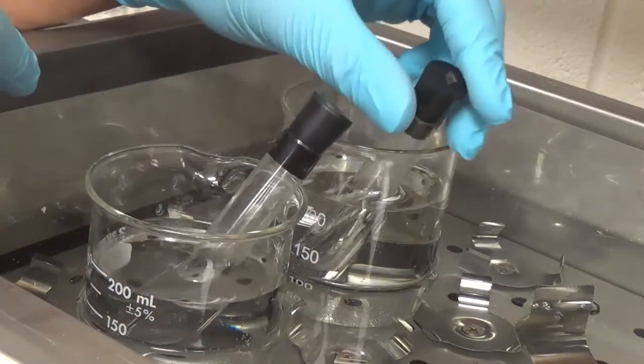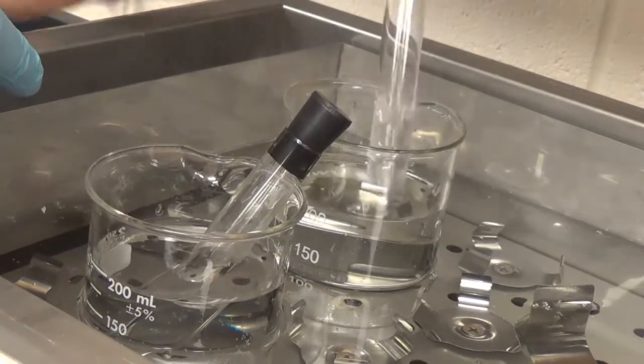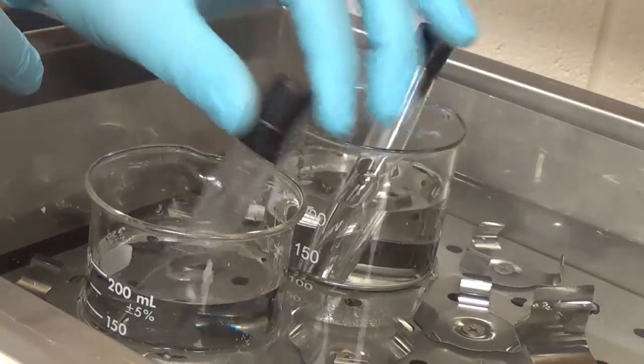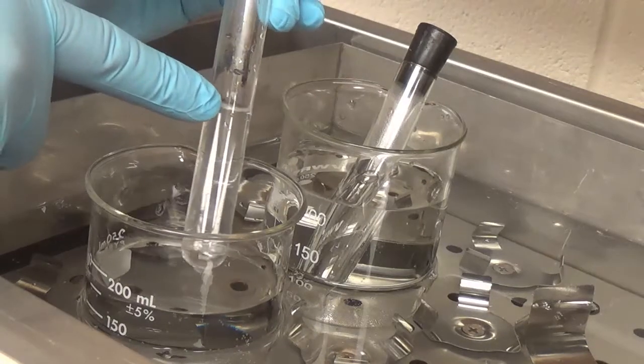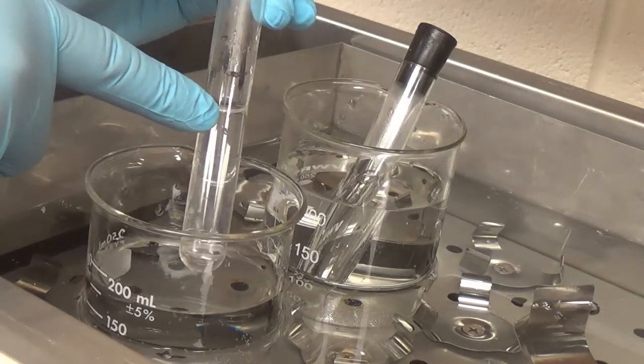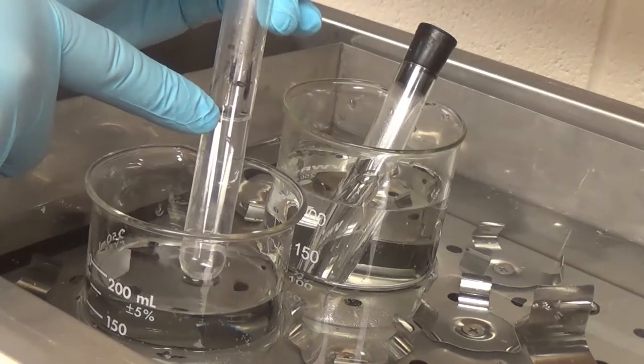The potassium persulfate here is sitting at 35 degrees all by itself. Everything except the potassium persulfate is at 35. Again, I want to reiterate, special emphasis, these are all experiment 1 volumes done at 35 degrees C.